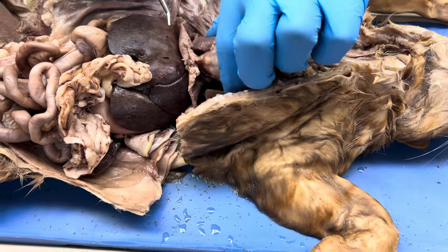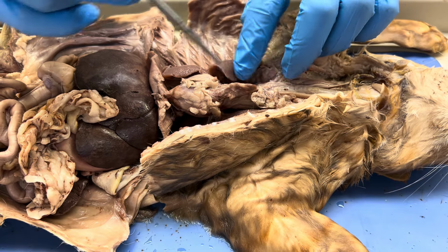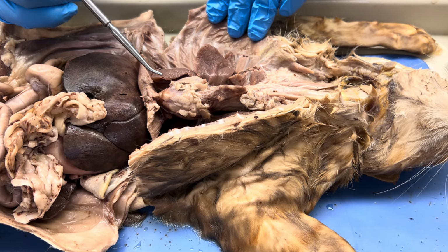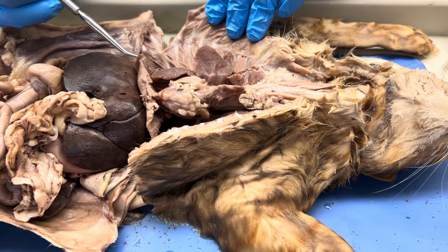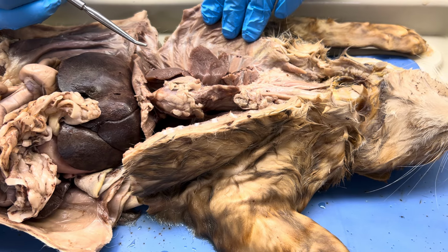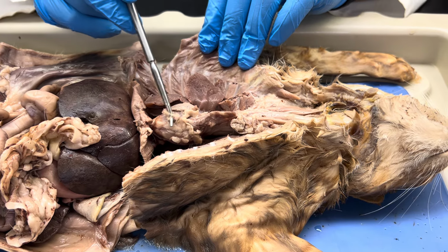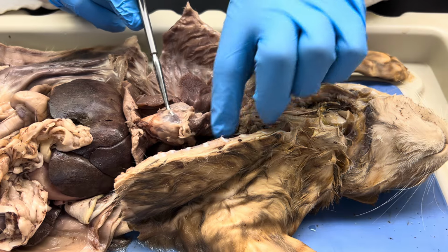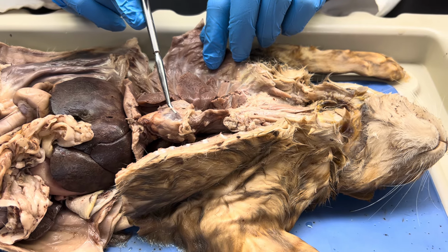Mediastinum is a space between the two lungs, so I'm hoping y'all remember that from A&P1, but it would be in the middle, so I'm not gonna try and pull that lung over, but hopefully you understand that concept. Parietal pericardium, so here we go again, another serous membrane. Parietal pericardium lines the mediastinum, so watch this. I've already cut this away. Yep, there we go. See this layer right here that I'm lifting up? That's the parietal pericardium, okay?